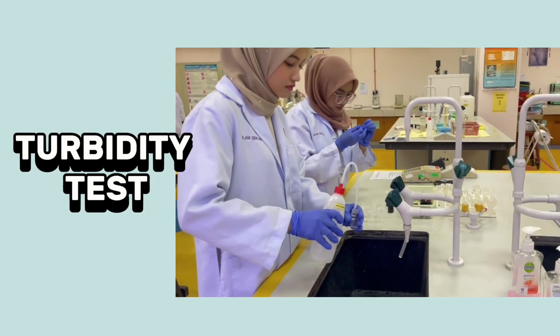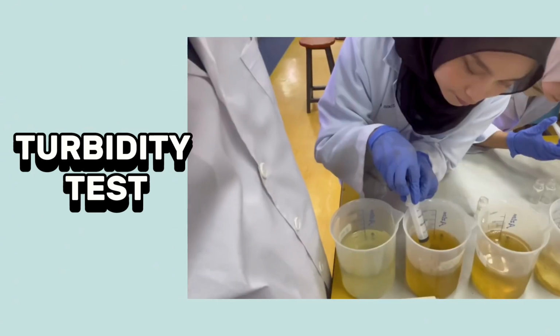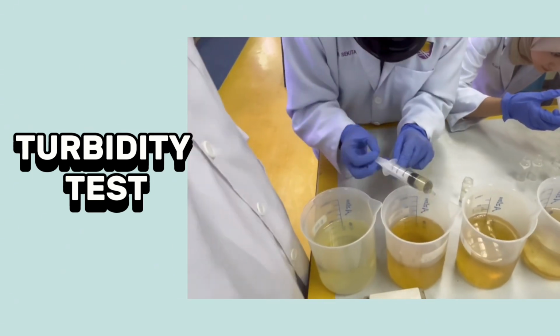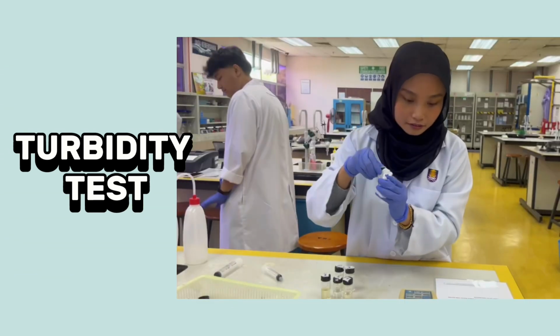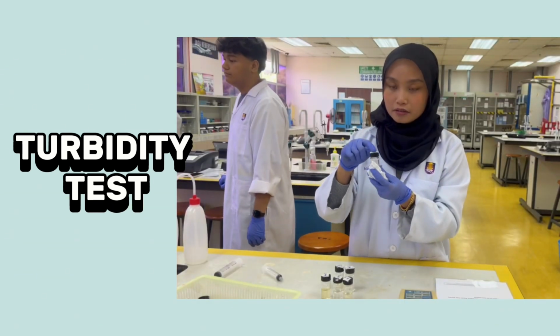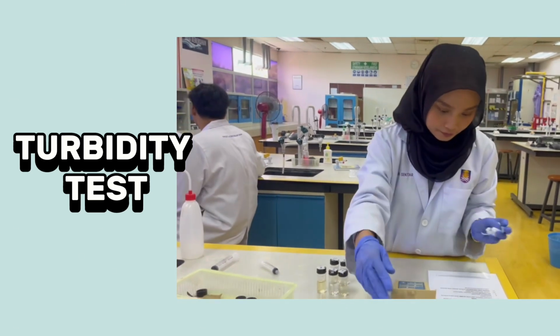For the turbidity test, first rinse the turbidity bottle with distilled water. Next, 10 ml of water sample was poured into the turbidity bottle. Wipe each turbidity bottle with tissue before inserting it into the turbidity meter, and the readings were recorded.